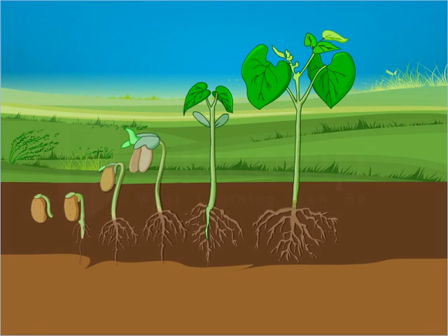Let us conduct an activity to study cells and tissues that help a plant to grow by observing the root tip of the onion.